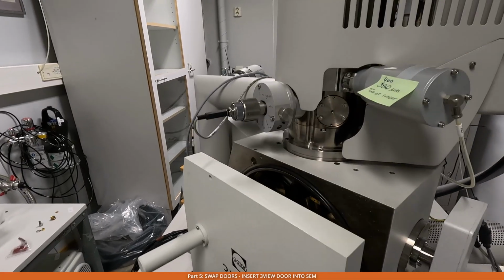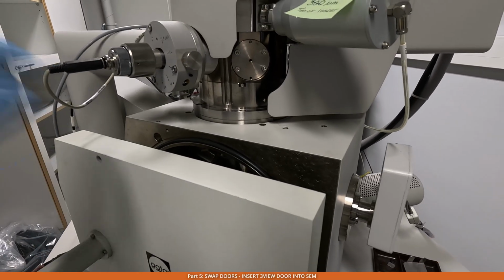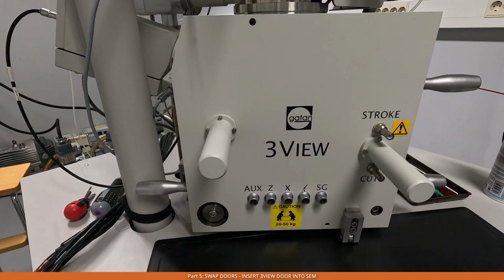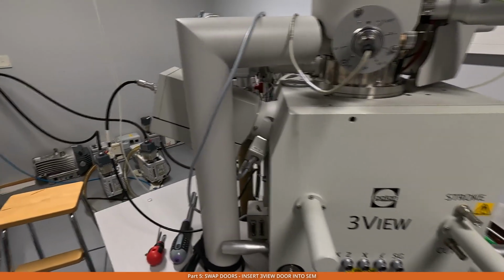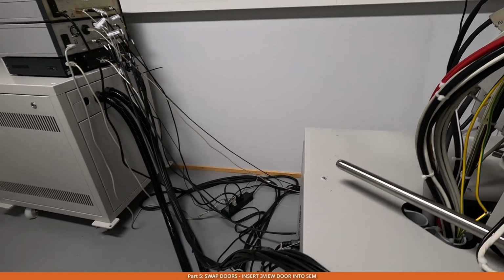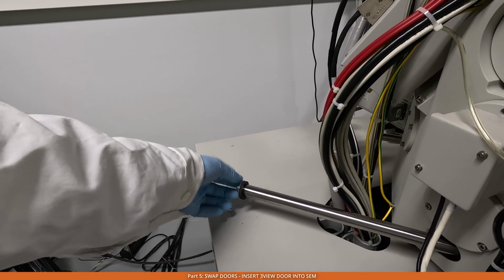When closing the chamber door, make sure to do it very carefully and check, because if you put the detector not properly or not really tight, then it may potentially hit the top part of the microtome. Now, when we close the door, we need to make sure that this locking screw is there. So we go to the back of the system and put this locking screw to make sure that when the door is open, it won't fall from the microscope.